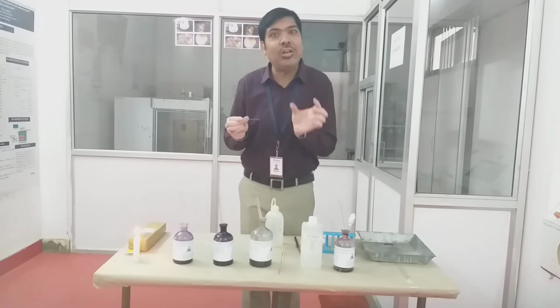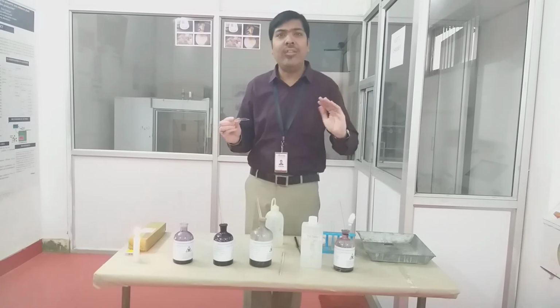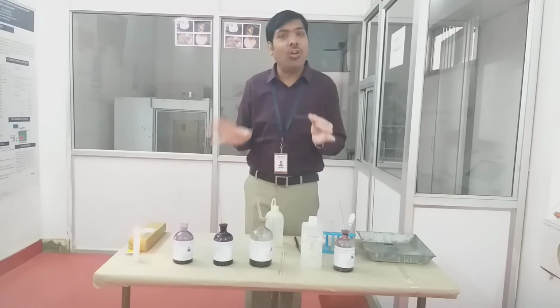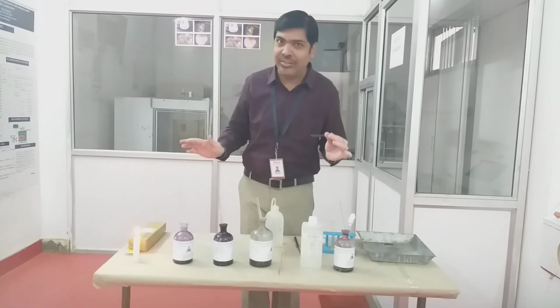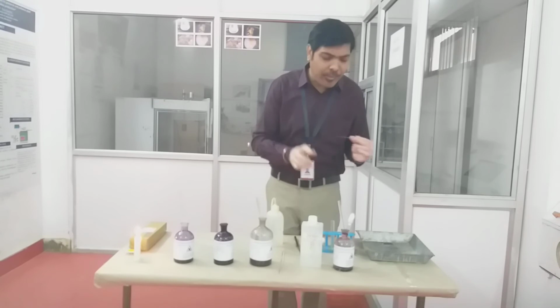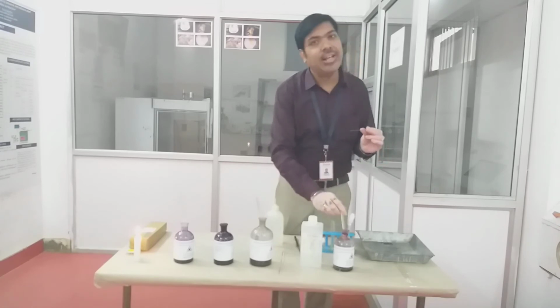and because of the CVI complex, the gram positive cell will appear very violet or very near to black color. But now, because of the application of the decolorizing agent, whatever gram negative cells are available are decolorized. Now the next step is the addition of the counter stain. Here I am adding the counter stain, and in gram staining the counter stain is safranin.